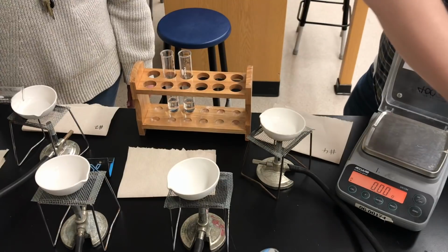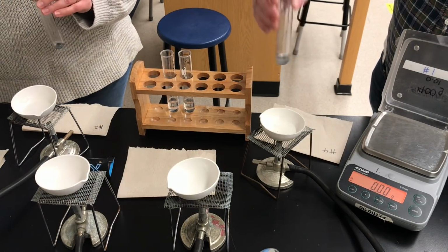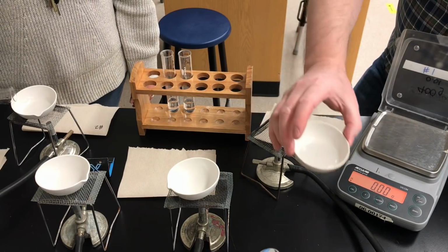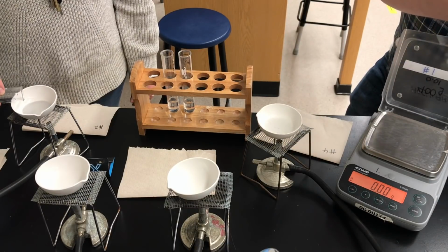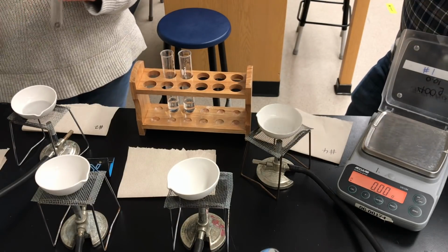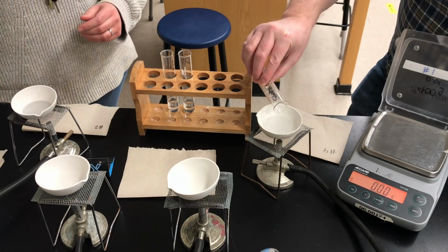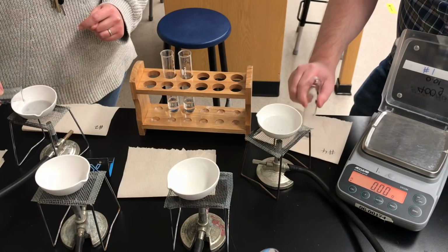So I'm going to add some distilled water, because remember that the zinc chloride was dissolved in the water that was above the leftover zinc. We want to make sure all of the zinc chloride gets added to the dish. There's a few tiny little pieces of gray in my evaporating dish, so I'm getting a tiny bit of excess zinc metal into the dish, and that's a source of error. Ideally, I would want only the zinc chloride and water to be poured into the dish. So you might note for yourself that there's a small amount of zinc metal which is being added to the dish. Now I've rinsed 2 or 3 times.